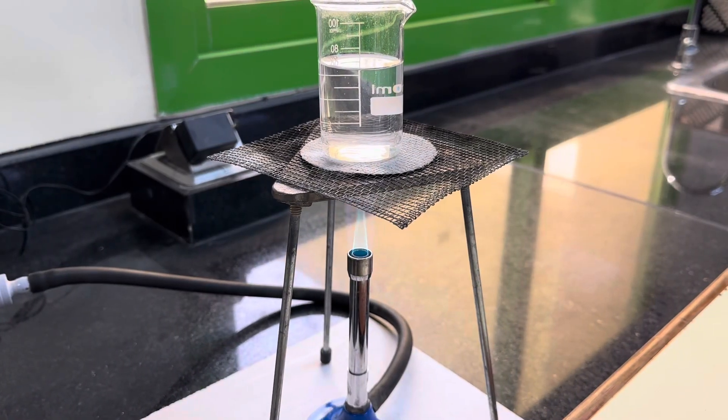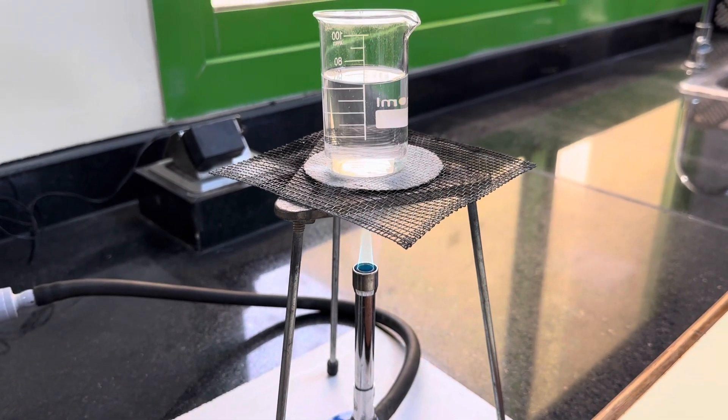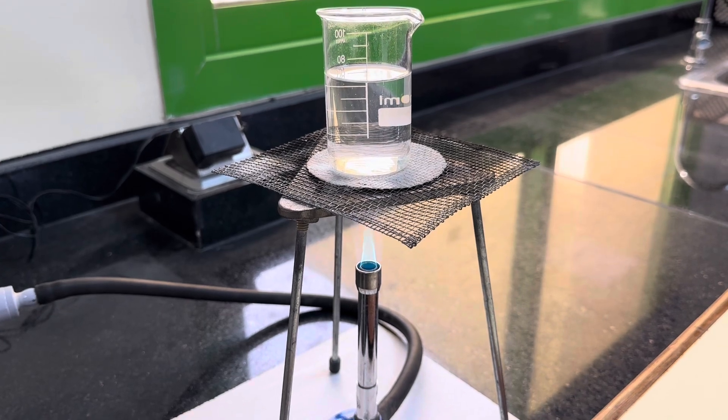Hi YouTube. Today we're going to be investigating the solubility of a solid in water. The solid that we're going to be choosing is potassium nitrate. This is a procedure that we can use to measure the solubility of potassium nitrate in water at 40 degrees.